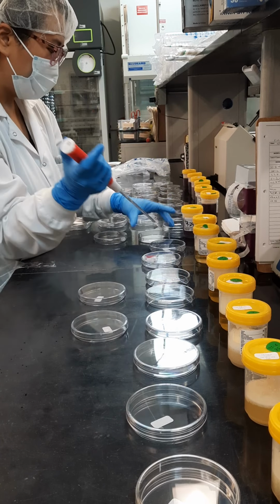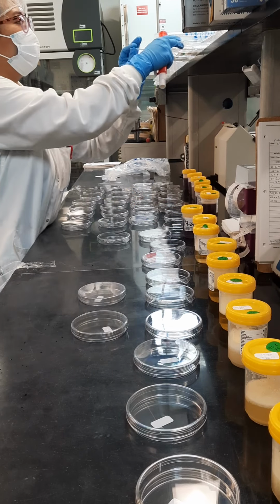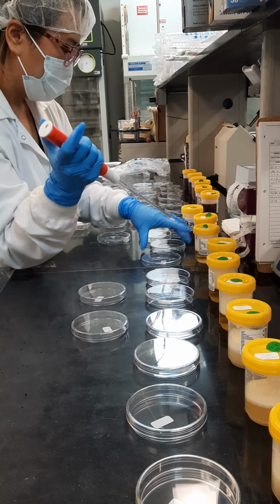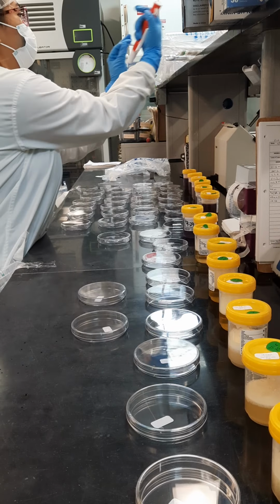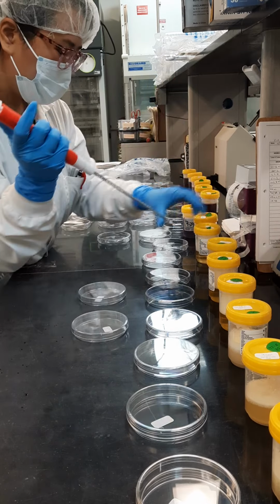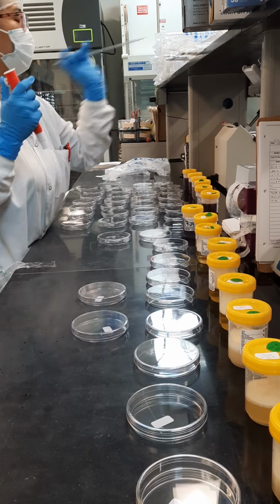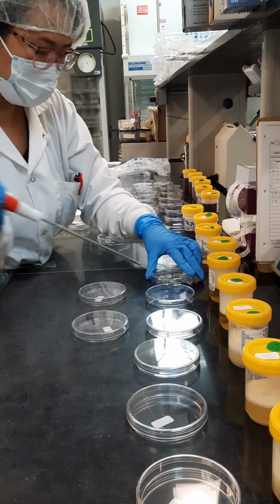You just have to put 2 bags together, one inside of another, and then fold the lips. It's always good to start off your cleaning with isopropyl in your hands also, check there.